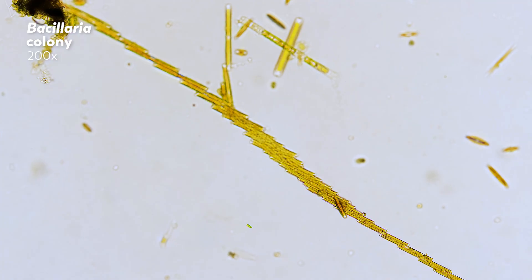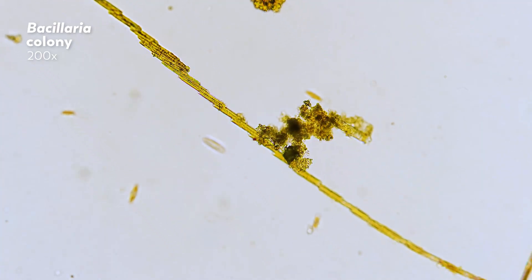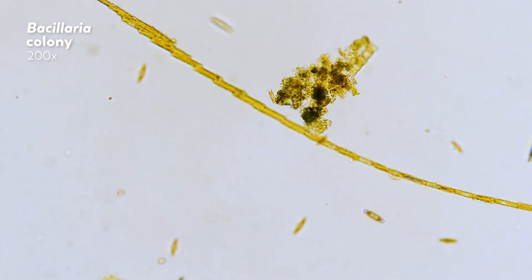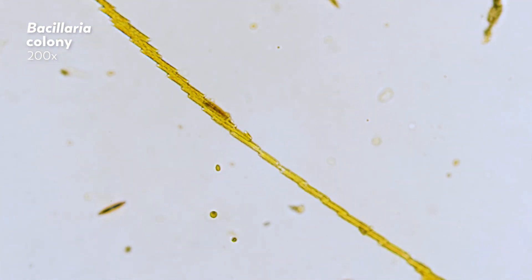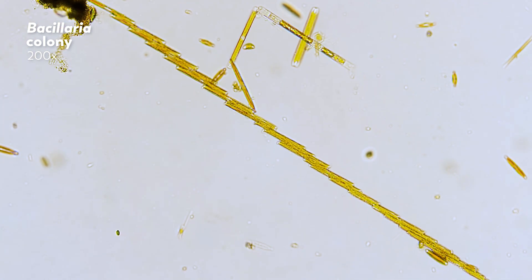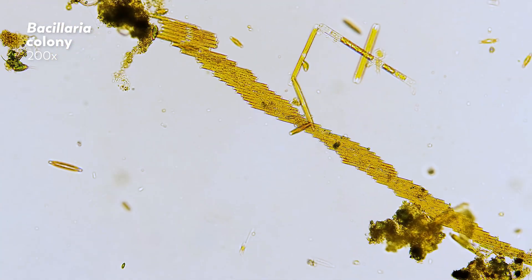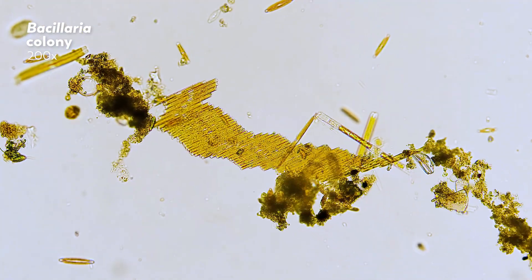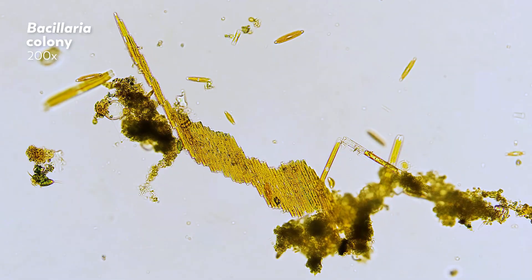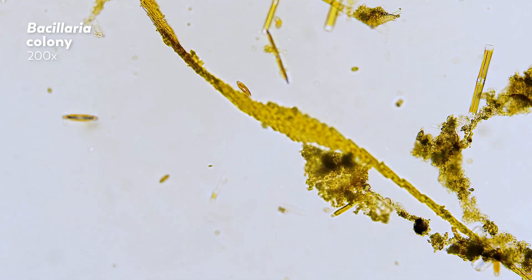You might say that this is as close as we get to seeing what the microcosmos actually looks like. But that would be like taking a 2,000 watt lightbulb into your living room and saying, 'this is what my home looks like.' Light affects things. And we're not even shining light on these organisms — we're shining light through them. Brightfield might seem relatively simple, but that simplicity has been incredibly powerful. Still, one of the major challenges for brightfield microscopy, particularly when looking at microbes, is contrast.